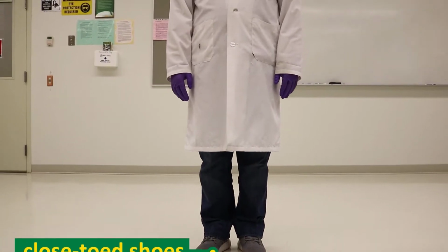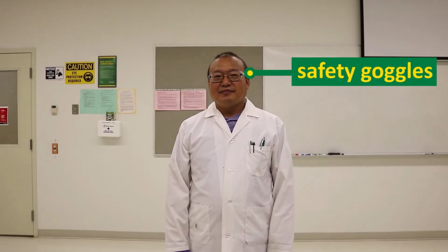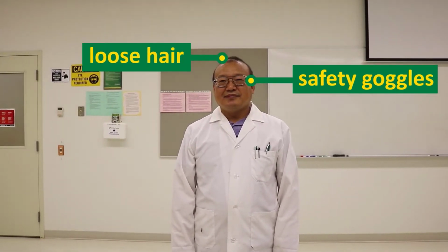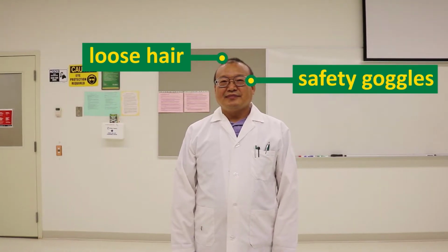First, proper PPE must be worn. This includes closed-toed shoes, a lab coat, safety gloves, wearing safety goggles, and making sure any loose hair is tied back or put in a bun.